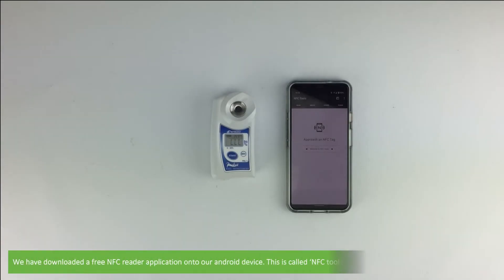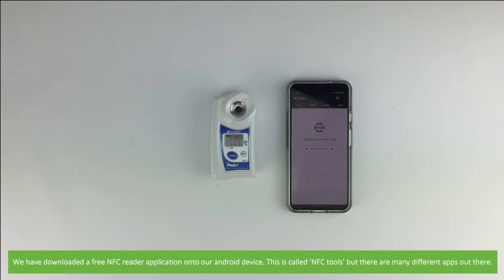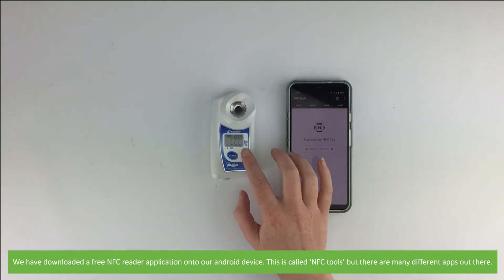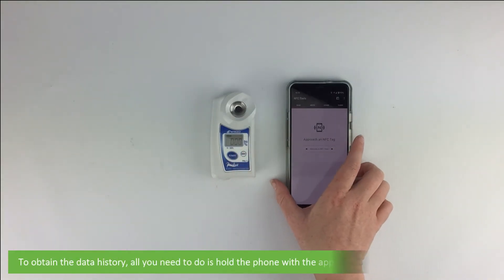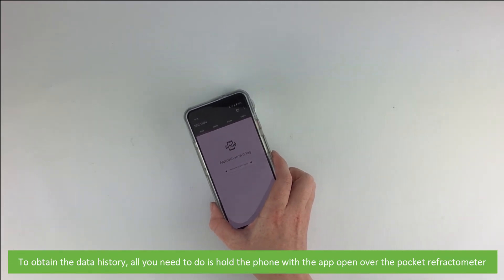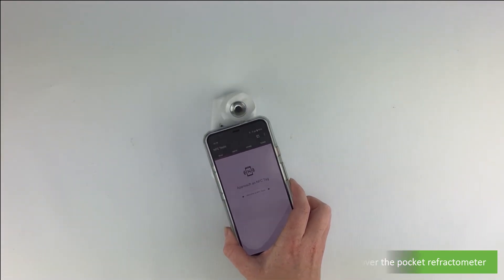We have downloaded a free NFC reader application onto our Android device. This is called NFC Tools, but there are many different apps out there. To obtain the data history from the pocket meter, all you need to do is hold the phone with the app open over the pocket meter.